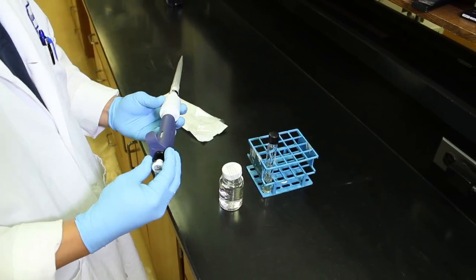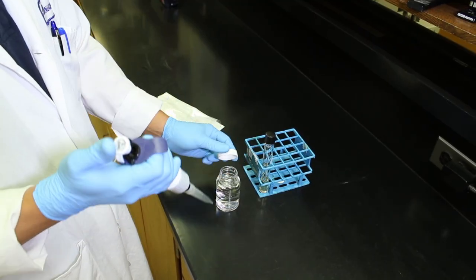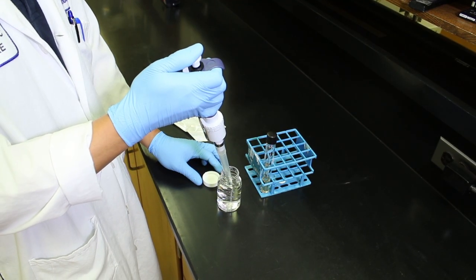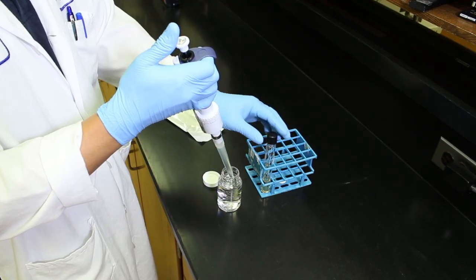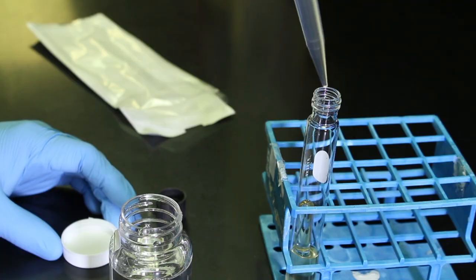The analysis begins with the presumptive test. Here, a 10-milliliter sample of water is carefully added into a sterilized test tube containing the lauryl tryptose broth.